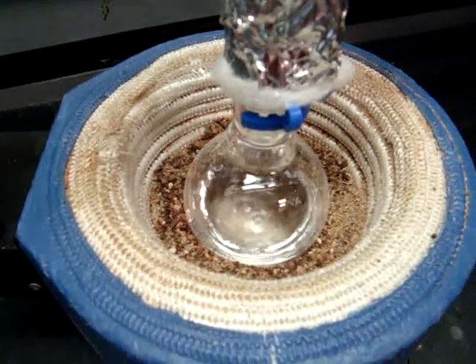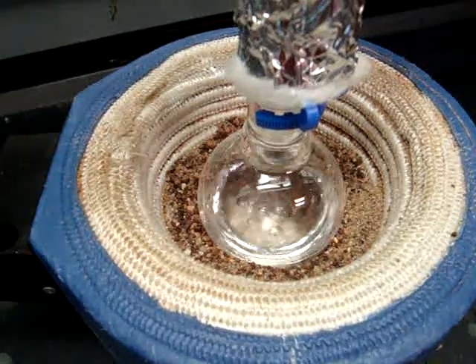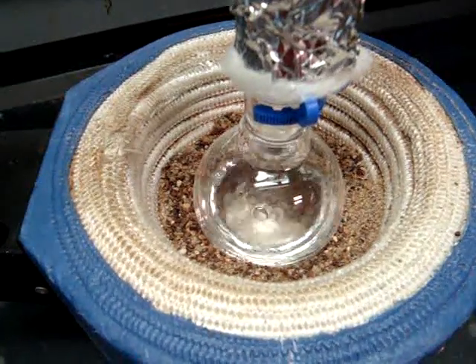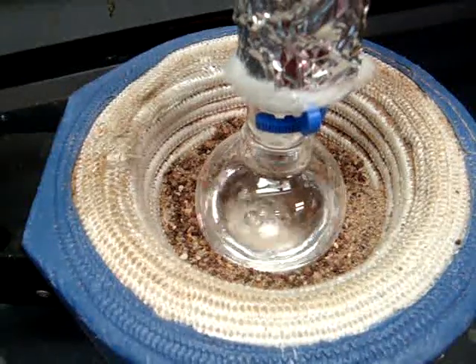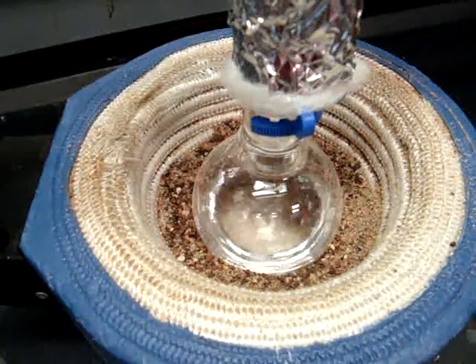At the end, you will remove most of the solvent, but you need to make sure that you don't allow the round bottom flask to go completely dry.